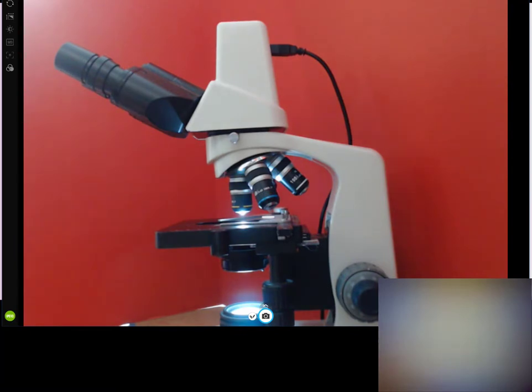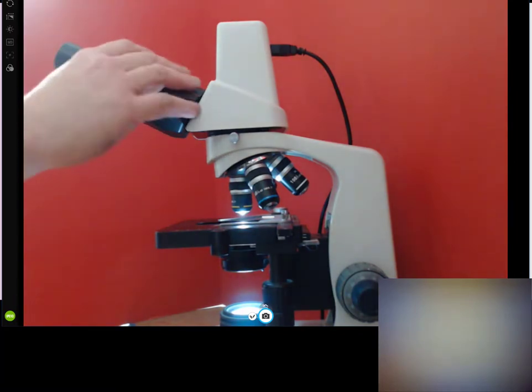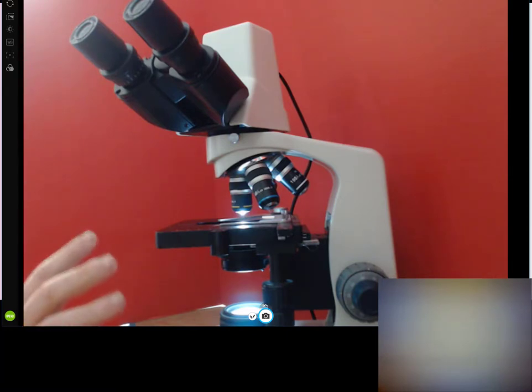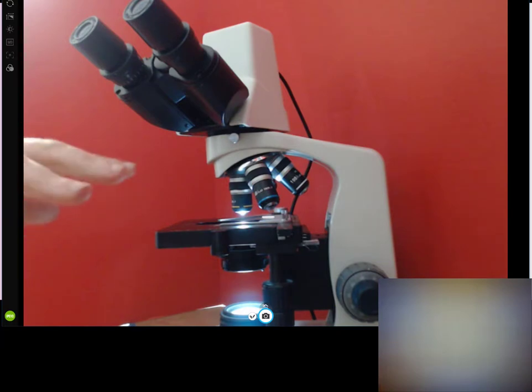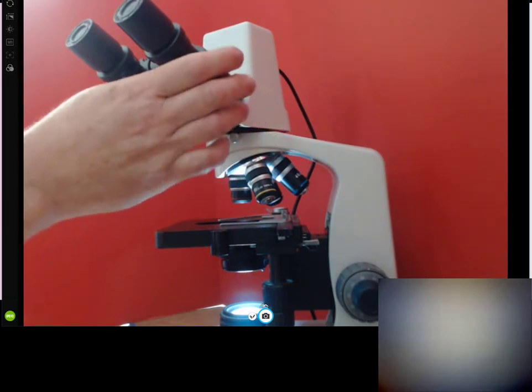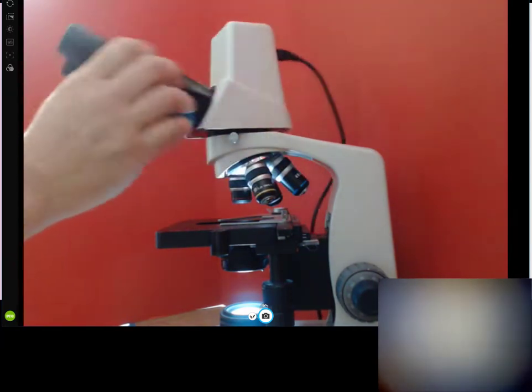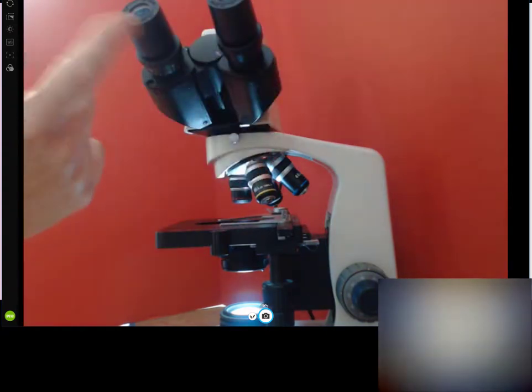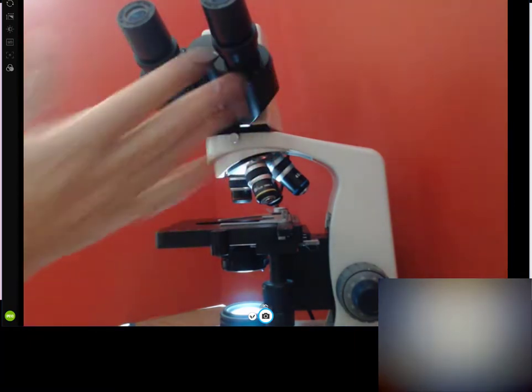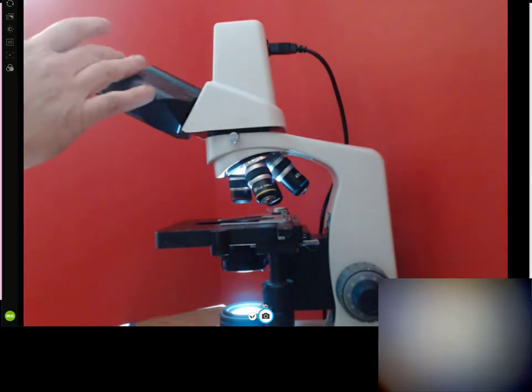Up here we have the binocular head. I have a rotating head on mine, which is nice because I don't have to move the microscope, which causes vibrations — these lenses are very sensitive. It's binocular, so you can adjust the width if your eyes are farther apart, just like a pair of binoculars. You can also have a partner look at it without moving the scope back and forth.